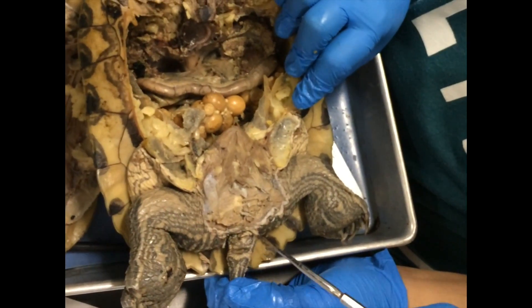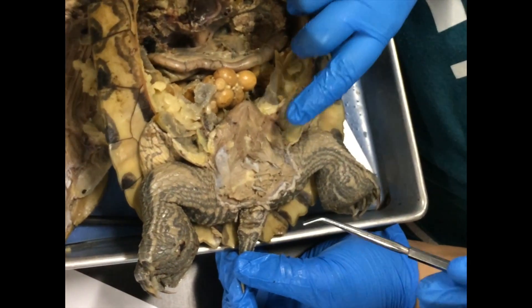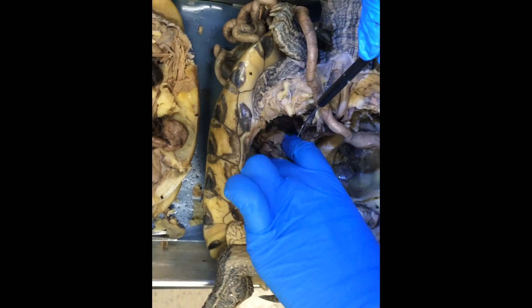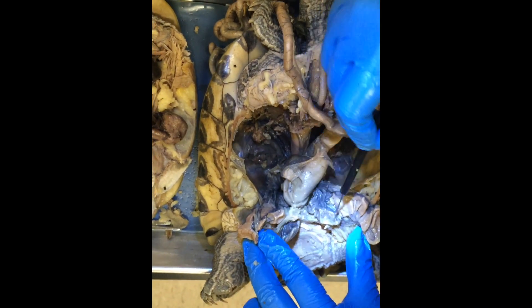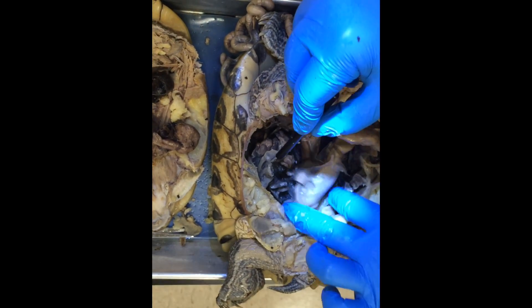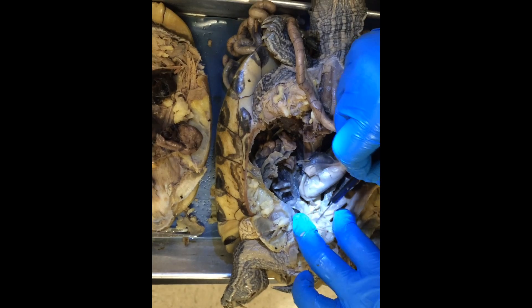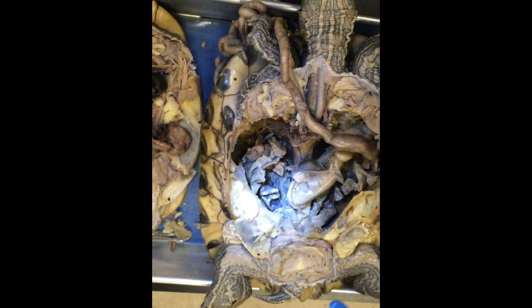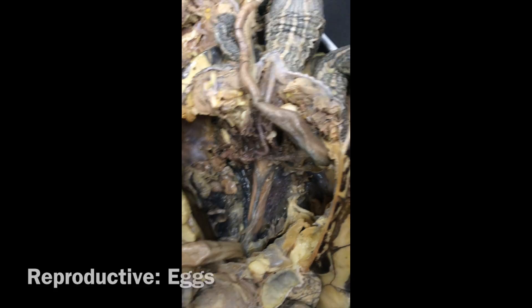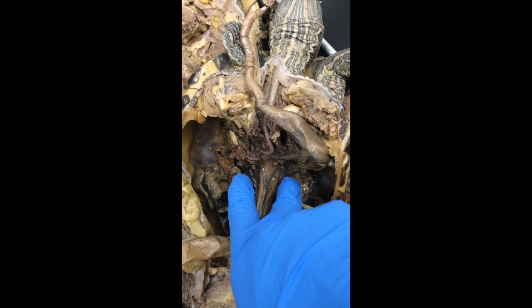The cloaca is an opening for the urinary and reproductive systems. It receives waste from the kidneys and fluids from the reproductive organs and transfers them to the external environment. Since this is a female, these are the two ovaries, and right here in this little membrane is where the eggs were held. Leading down from the ovaries are the oviducts that lead all the way down to the cloaca. Females are substantially bigger than males. These right here are the eggs of this turtle. For the male, it wouldn't have the ovaries but would have testes located right above the kidneys.